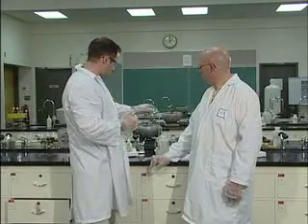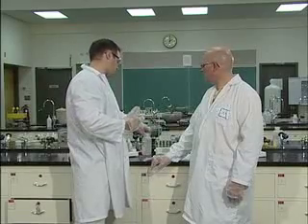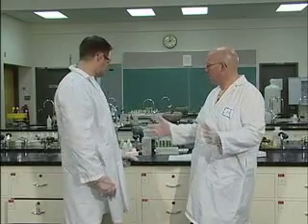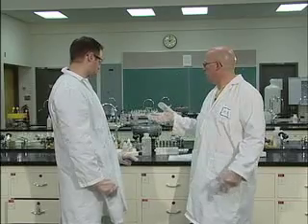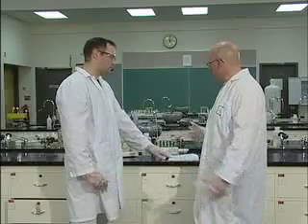And you would note a definite temperature change. And if your litmus paper turns blue, that's okay too, there'd be a pH change as well. Interesting though, because in the beaker it was just clear. He added the calcium oxide, and it just stayed clear. I couldn't visually see anything. However, we did see a temperature increase, and perhaps a pH change. Is that it for the first one? That's it for part A.